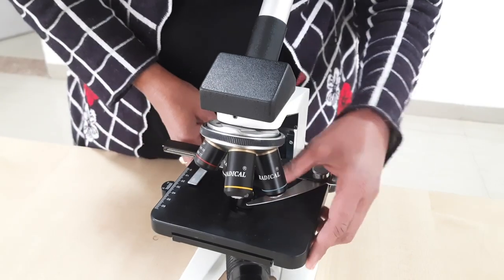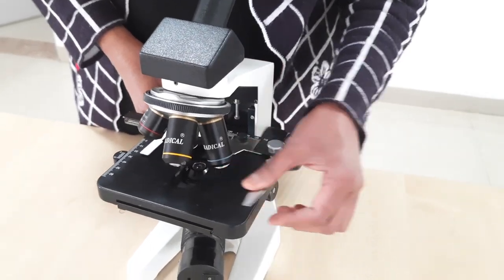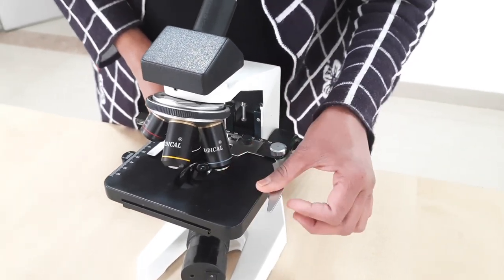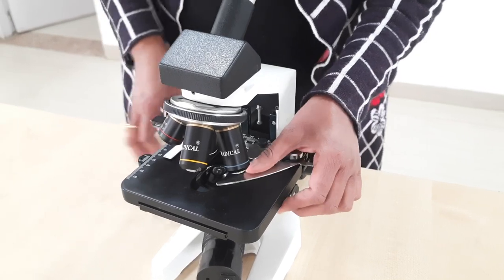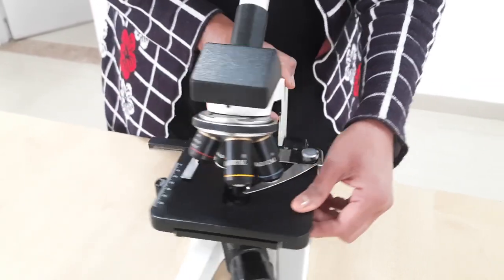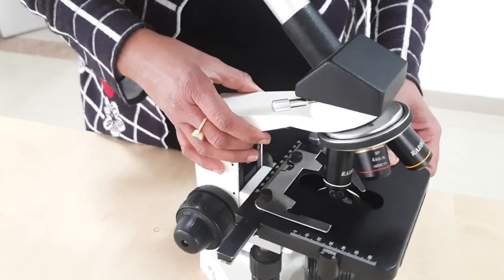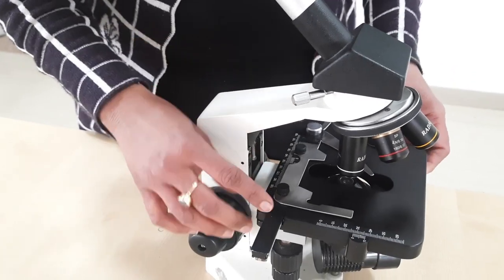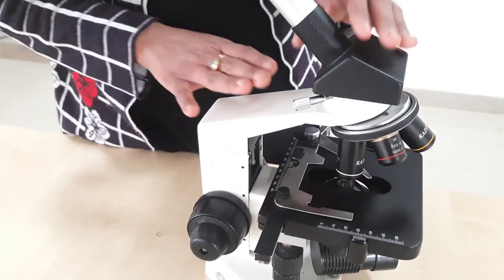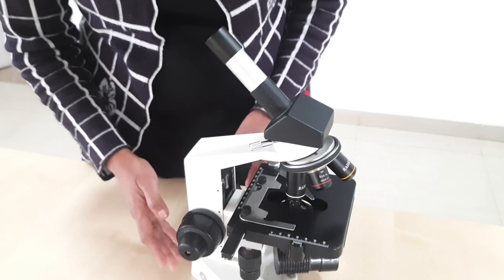Along with that, you can see there is a spring-mounted mechanical clip which is helpful in fixing the slide over the microscope. That covers the support system.